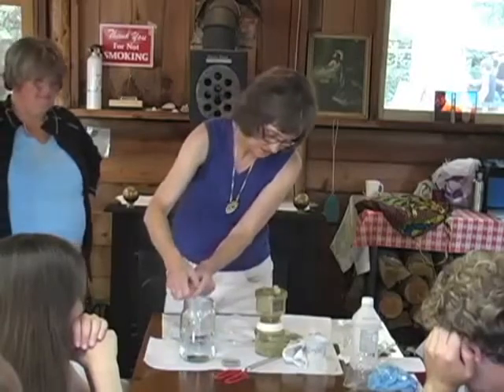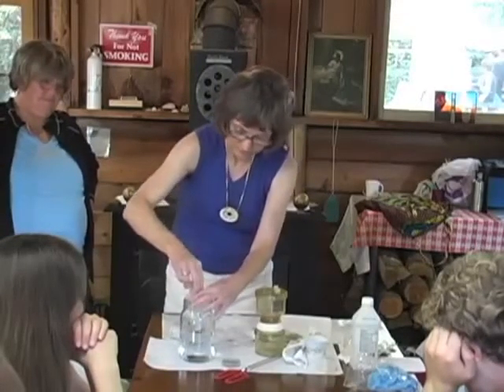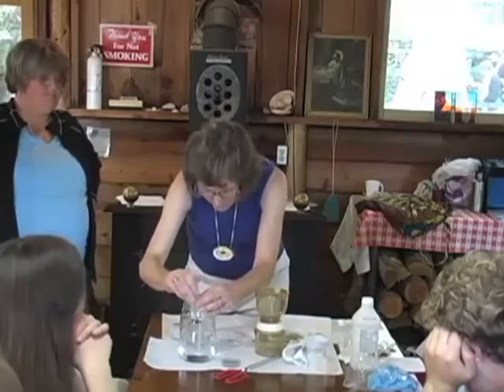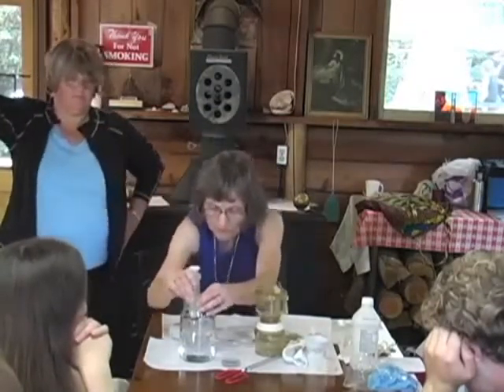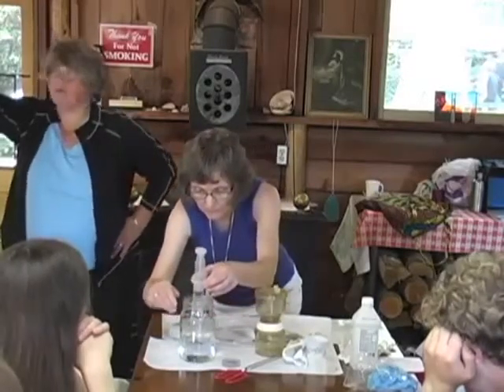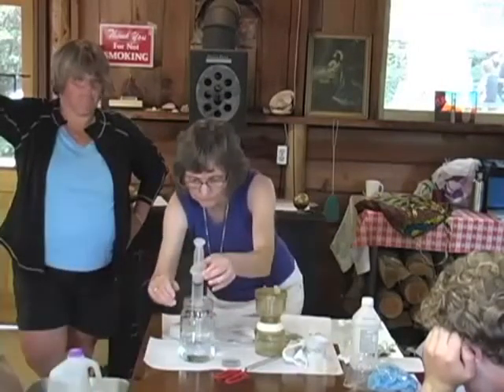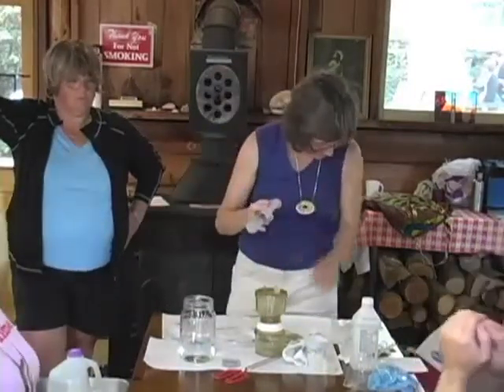It does say, note, if water quality at the sampling site is generally high, you may wish to filter an entire 100 milliliter sample. However, if water quality is poor, or animals such as geese or cows are present, filter less water. The idea is that if it looks clean, you may have to go through a lot of water to find the bugs that are problematic. If unsure, do 3 samples, 10 milliliters, 50 milliliters, and 100 milliliters. Okay, and then that's going in here.